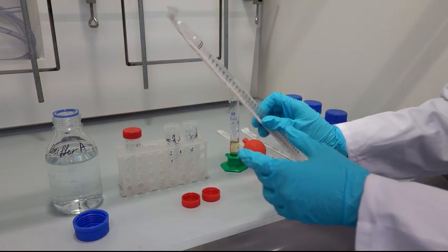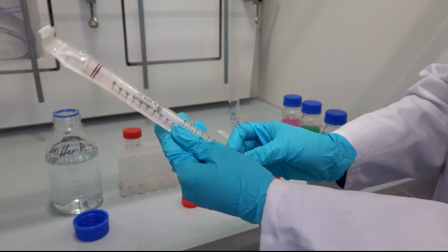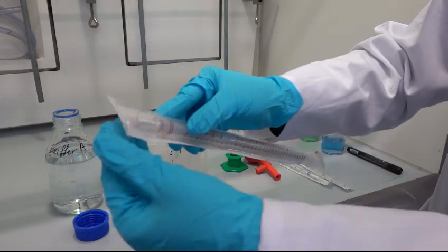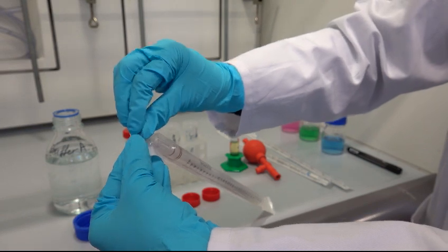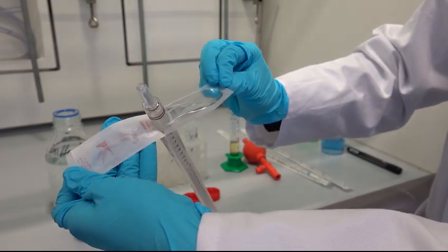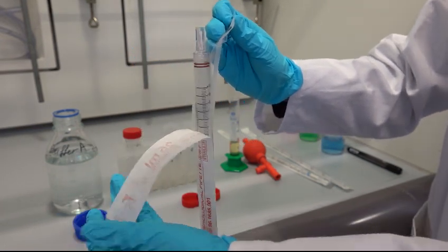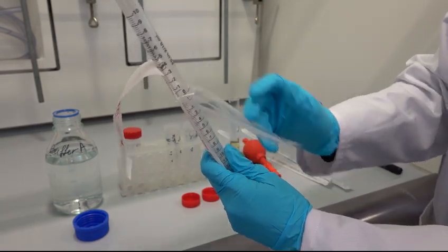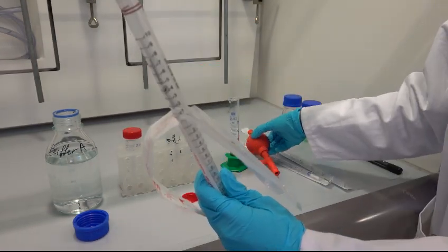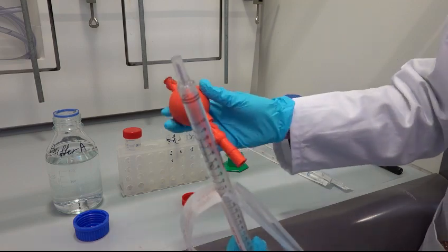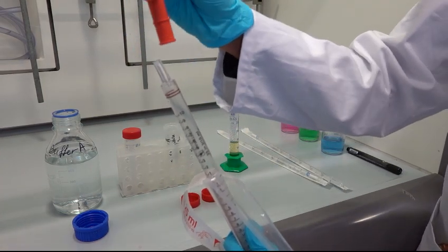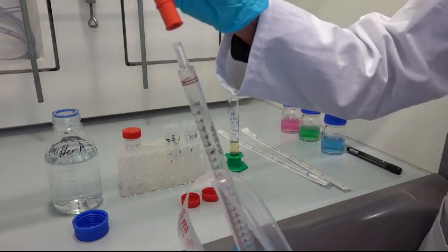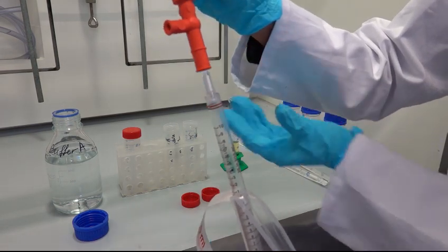Unwrap the pipette as shown in the video, only to half of the pipette and hold it from its upper part to avoid contamination. Add the pipetting ball at its end. Squeeze it before, collect 25 ml of buffer A, and transfer to the labeled tubes.